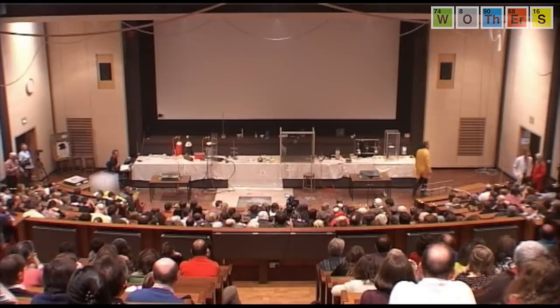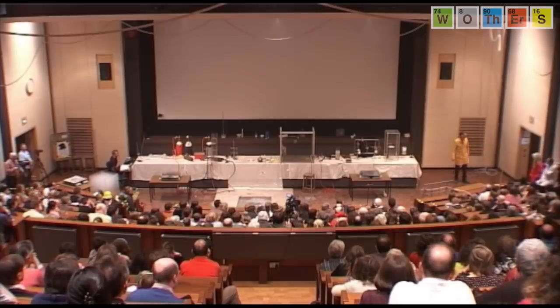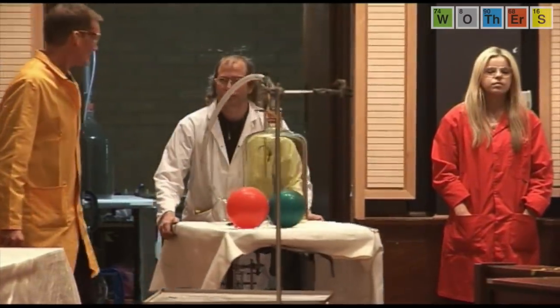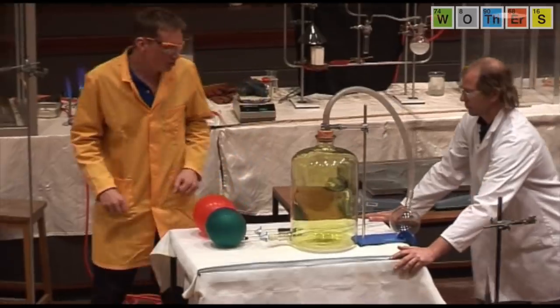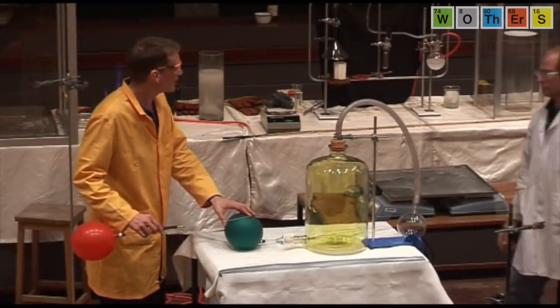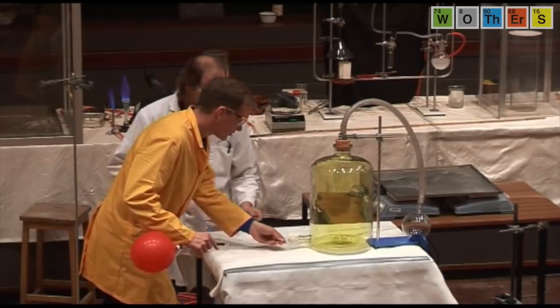We have another flask here. We're going to see if hydrogen can burn in chlorine. Okay, now, this time the hydrogen doesn't burn all by itself, it needs something to start it, so we're going to use some acetylene, some of the ethine, to start the reaction. So this balloon has the acetylene in, yes? Yes, please, yep. And this balloon has the hydrogen.